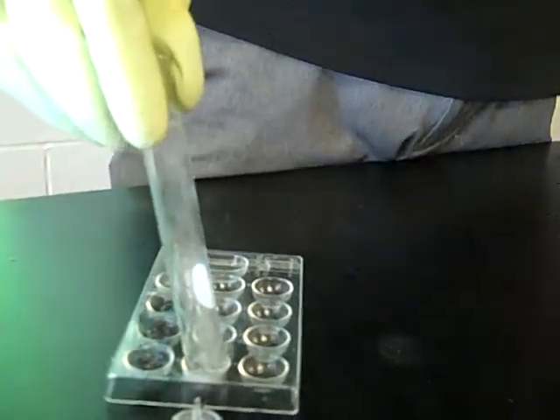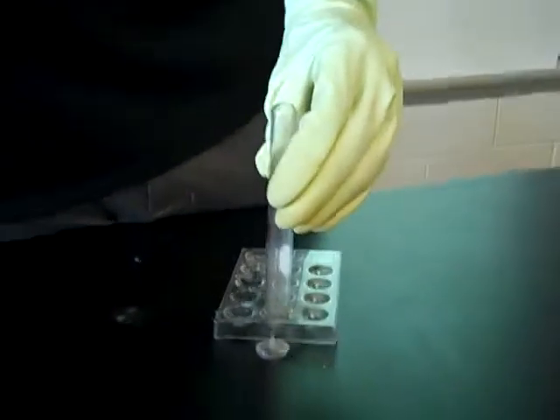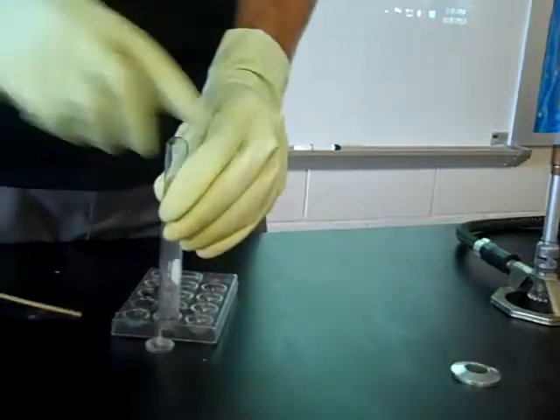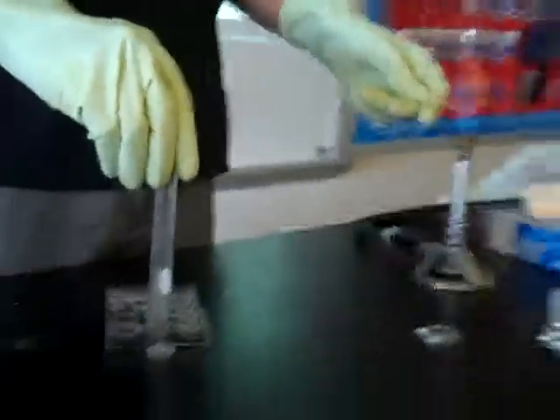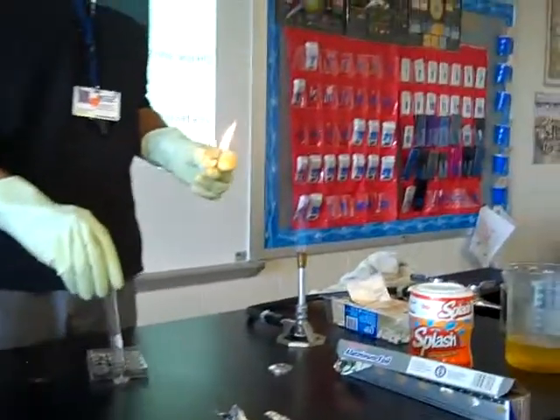Yeah, everybody just take a step back so everybody can see. You can go sit down in our desk. Go sit down in our desk. Okay? Alright, so here we go. So now, if this worked, we should have some hydrogen gas. So let's see.